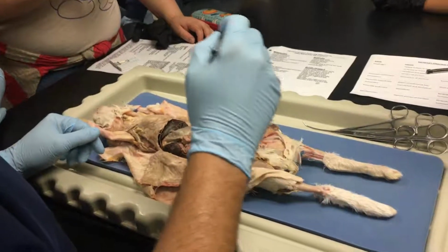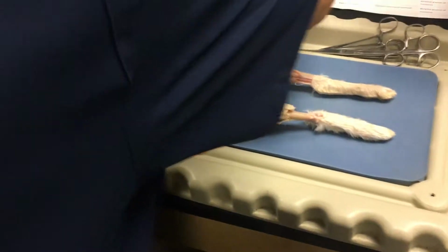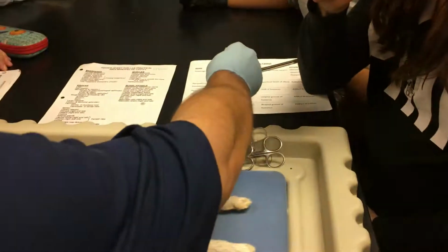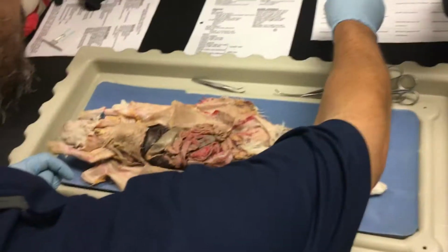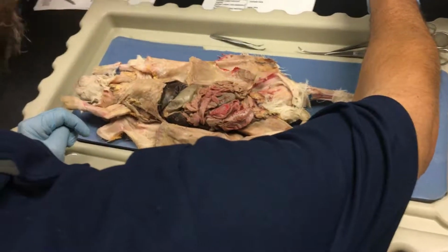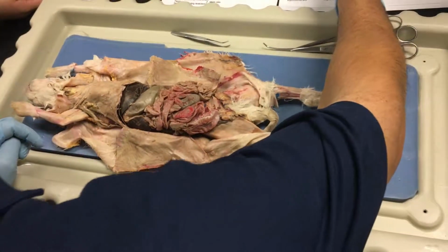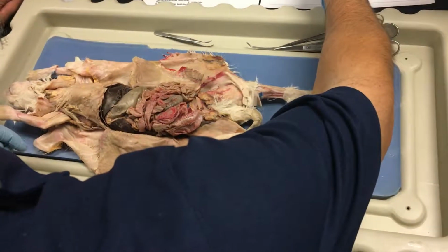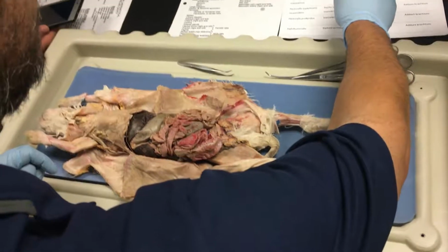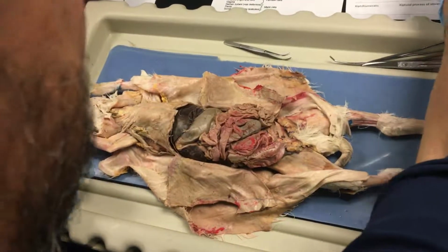Now I will tell you that as far as muscles are concerned, this is not a complete list. This handout is, however, both sides. So please make sure that you memorize both sides of this. And when I say memorize, you need to know, okay, diaphragm, the origin of the diaphragm is the ventral surface of centra of second to fourth lumbar vertebrae and xiphoid process of sternum. You need to know that. You need to have that memorized, okay?